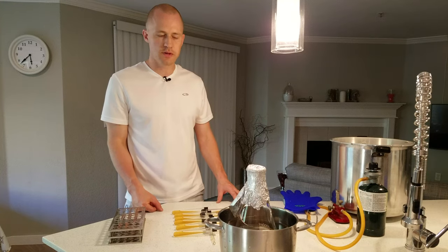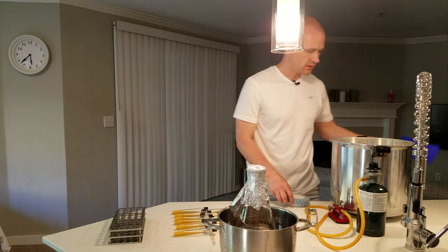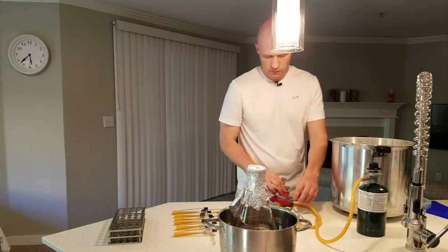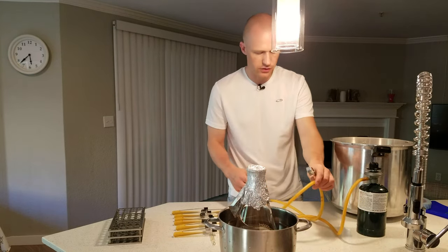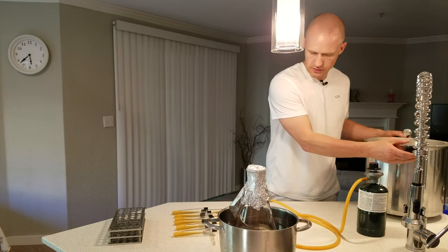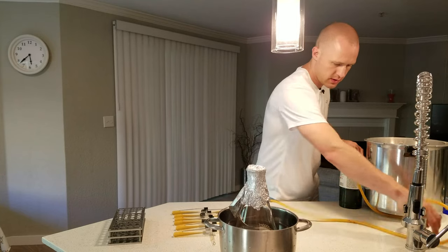We're now back for part three. What we're going to do is pour the plates. We already sanitized this area here. What we need now is a Bunsen burner — it just creates an updraft by burning propane.